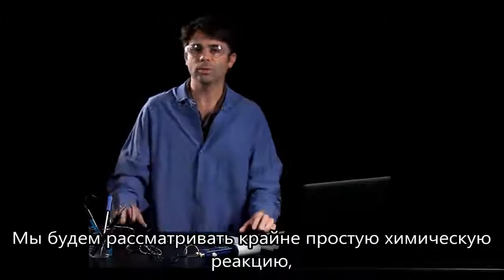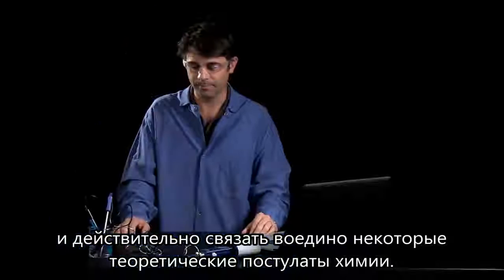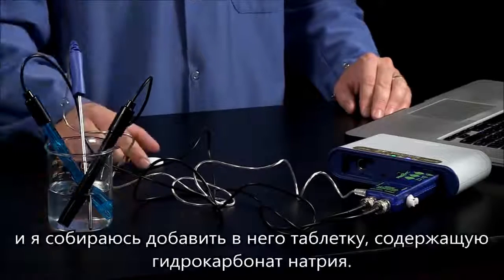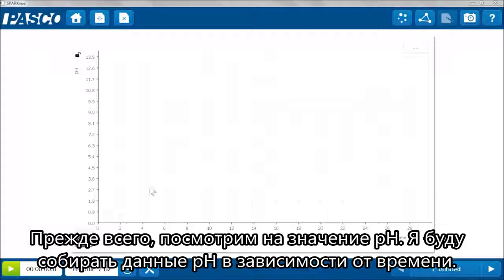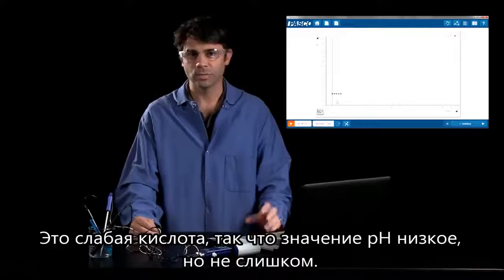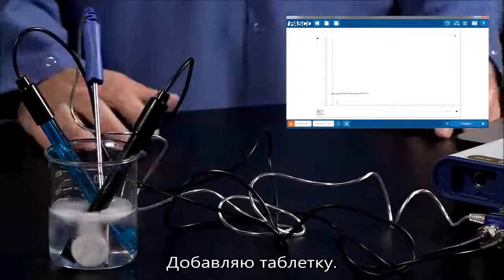So we're going to look at a very simple reaction, but see that we can get complex information out of it and really tie in some broad concepts in chemistry. In the solution here I have just some acetic acid, and I'm going to add an Alka-Seltzer to it. First we'll look at the pH. So over here I'm going to start my data collection of pH versus time. It's a weak acid, so I have a low but not too low pH. I'll add my Alka-Seltzer.